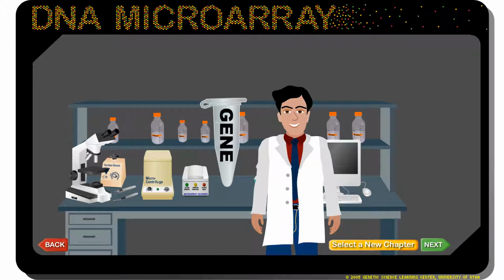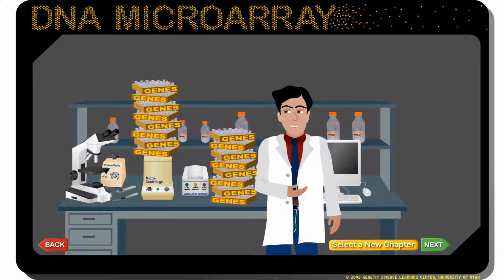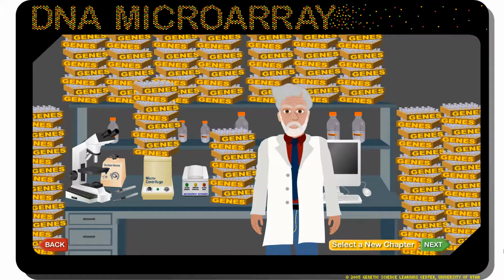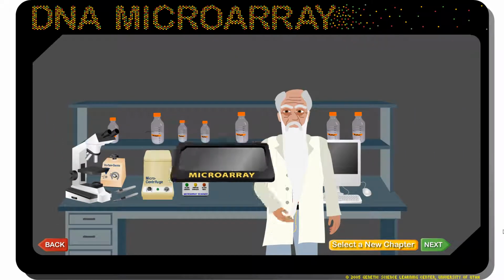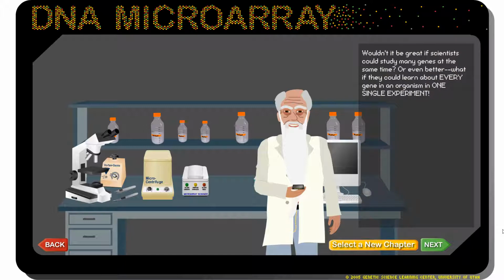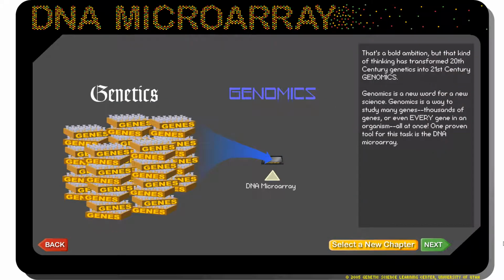A genome refers to the totality of the genetic information of an organism. Of course, since the establishment of molecular genetics, most investigators work with individual units called genes. If only one can hold all the genes in his or her hand, then it would be more convenient for researchers to study genes. DNA microarray is one technique that allowed this possibility. It also gave rise to a new discipline called genomics, which is at a different level than genetics, that can only handle one or a few genes that control a particular trait.